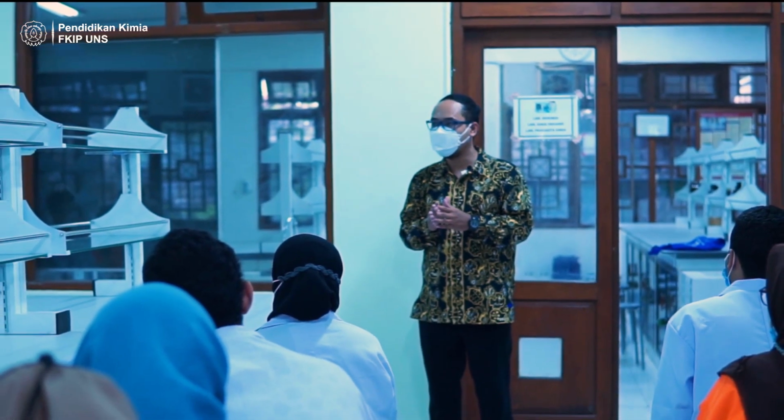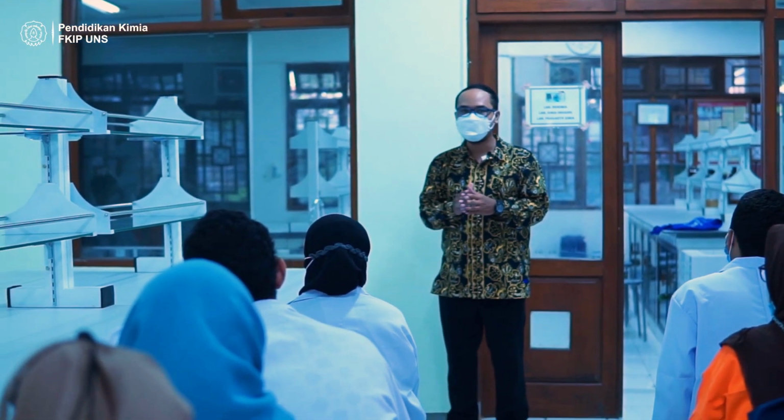After that, you analyze the solution using a UV spectrophotometer to determine the absorbance and the maximum wavelength of the solution at different pHs. Okay, if you have any questions, you can start to work on the pH indicator now.